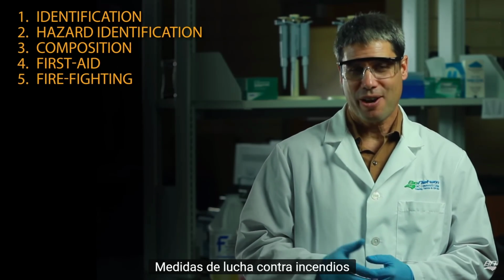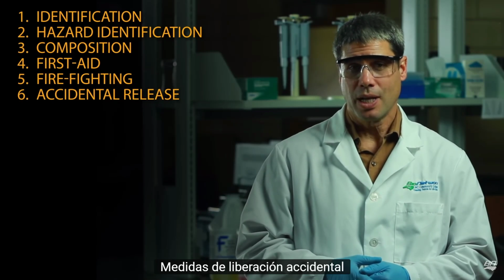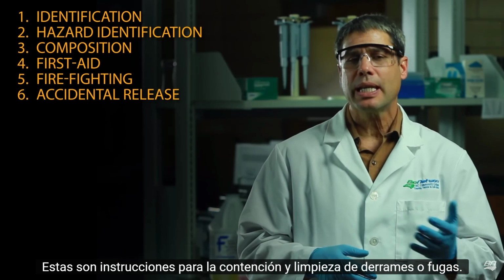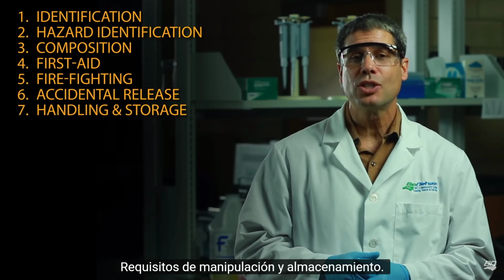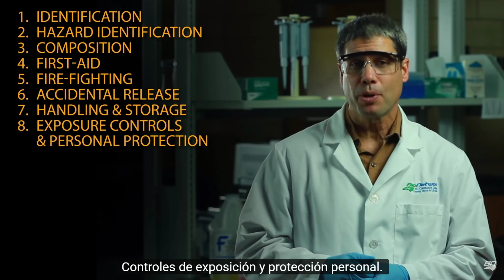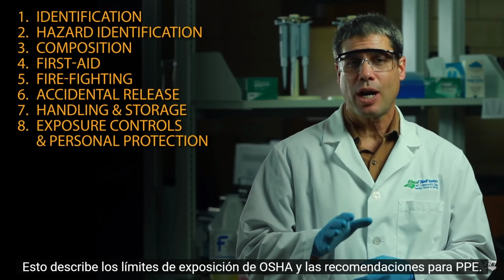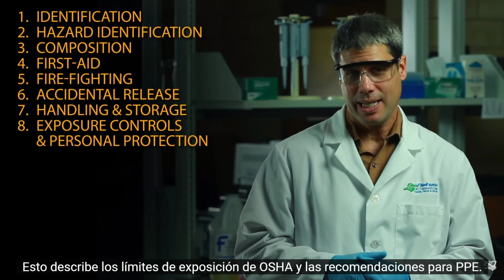5, Firefighting measures. 6, Accidental release measures. These are instructions for containment and cleanup of spills or leaks. 7, Handling and storage requirements. 8, Exposure controls and personal protection. This describes OSHA's exposure limits and recommendations for PPE.